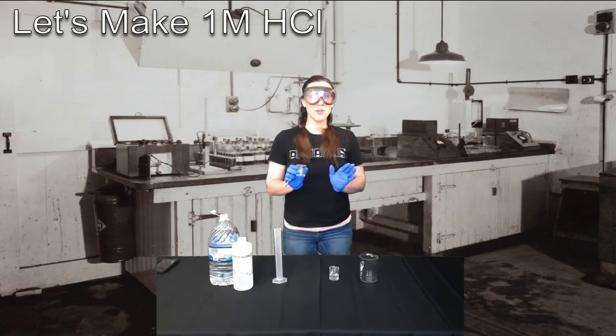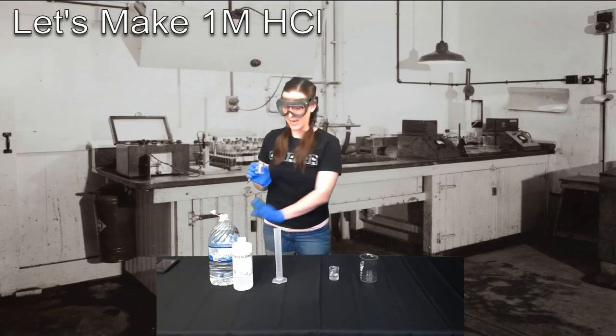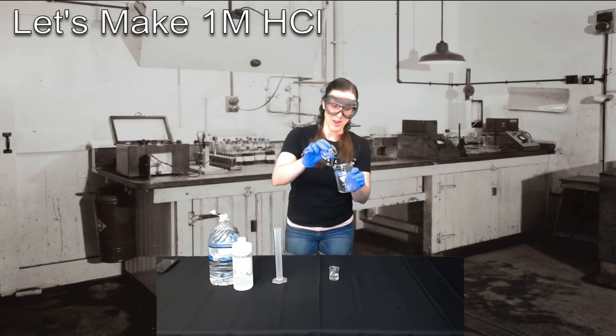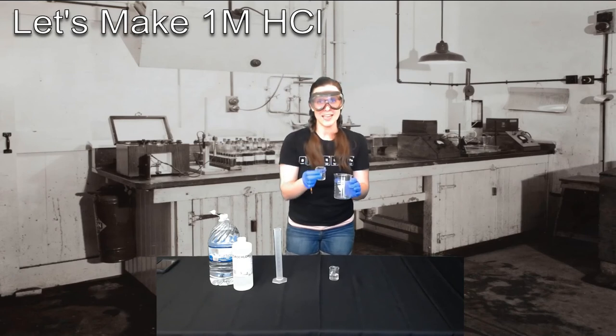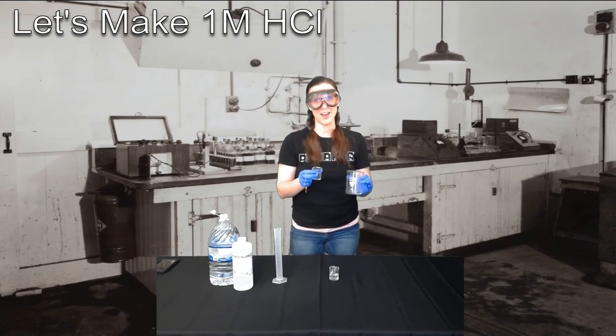Remember, whatever chemical you didn't use, whatever's left over, never ever goes back into the stock bottle. We're going to place that in our waste container or into your chemical carboy if you happen to have one in your lab.